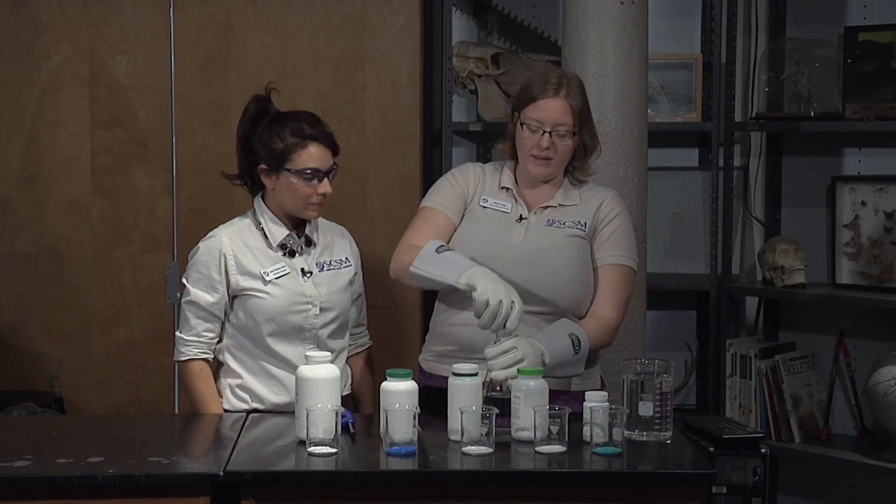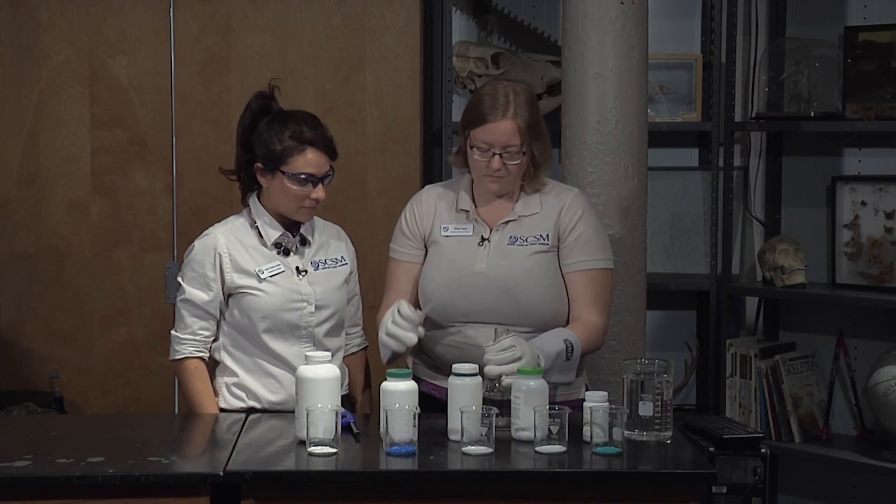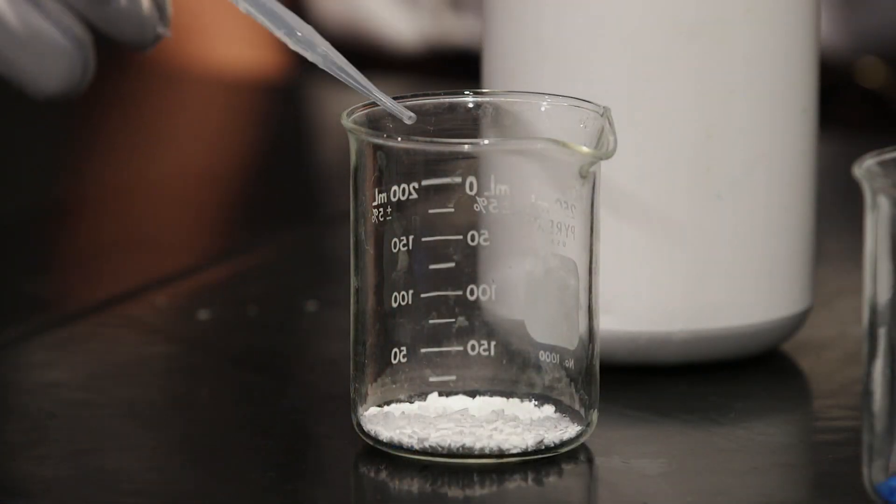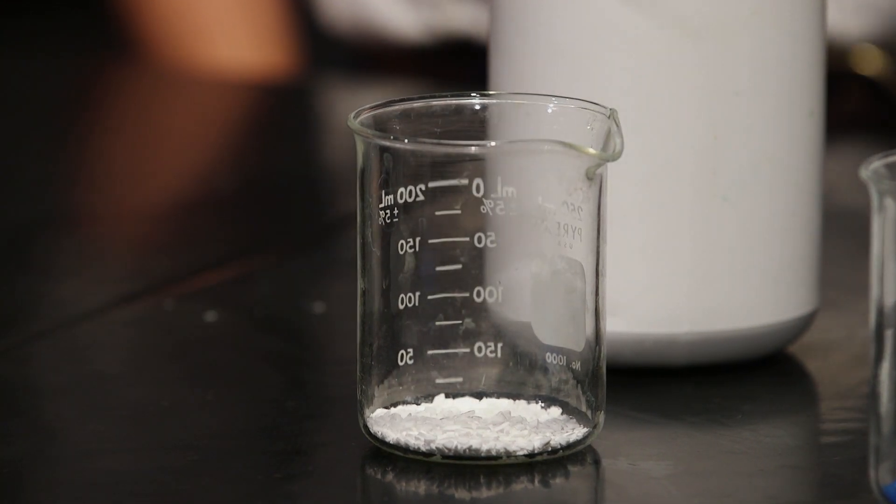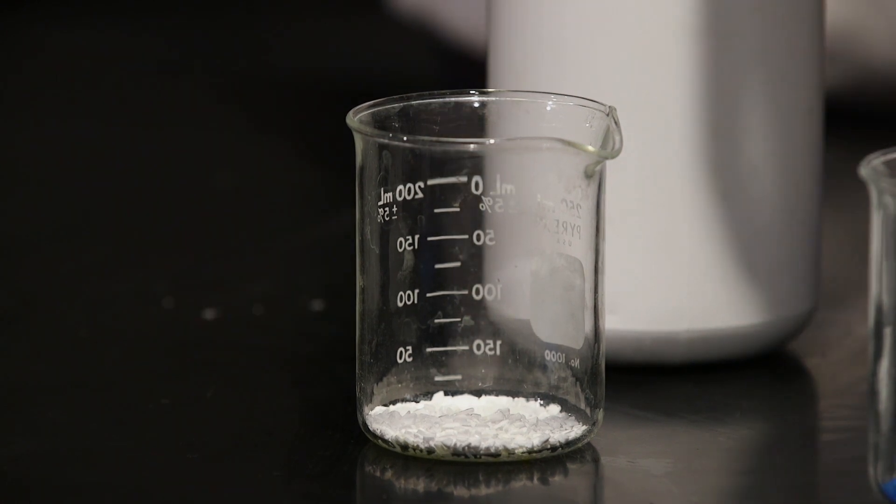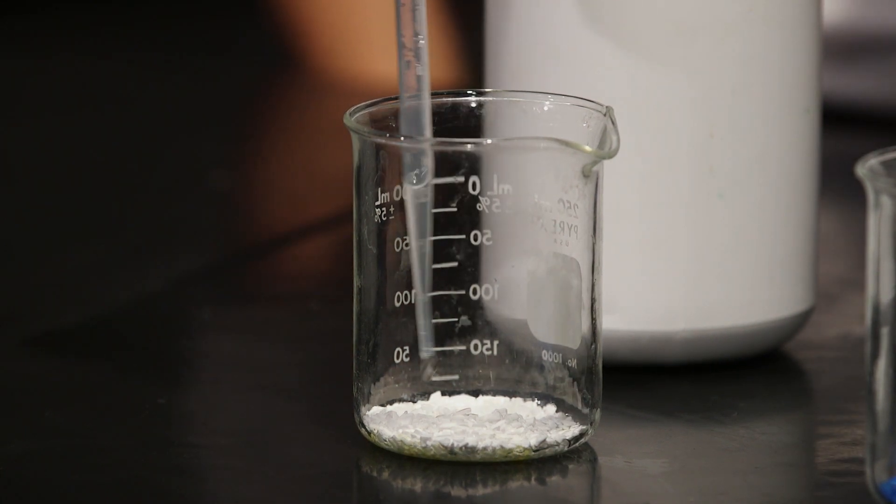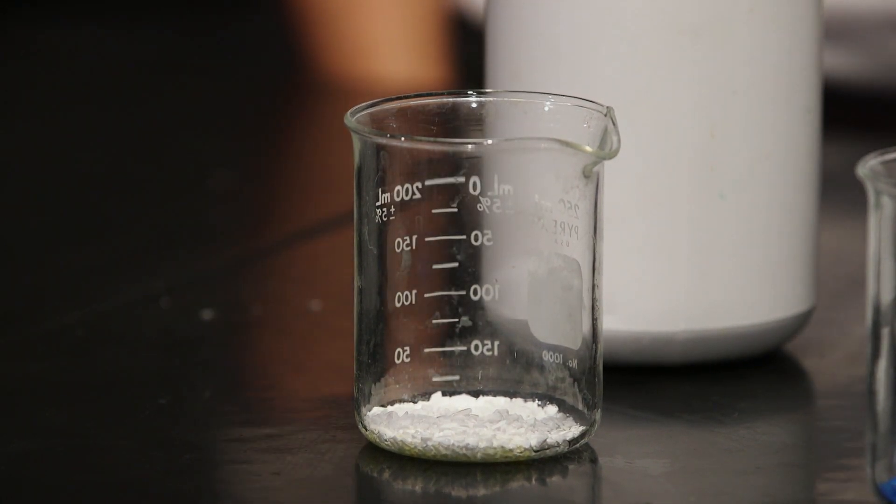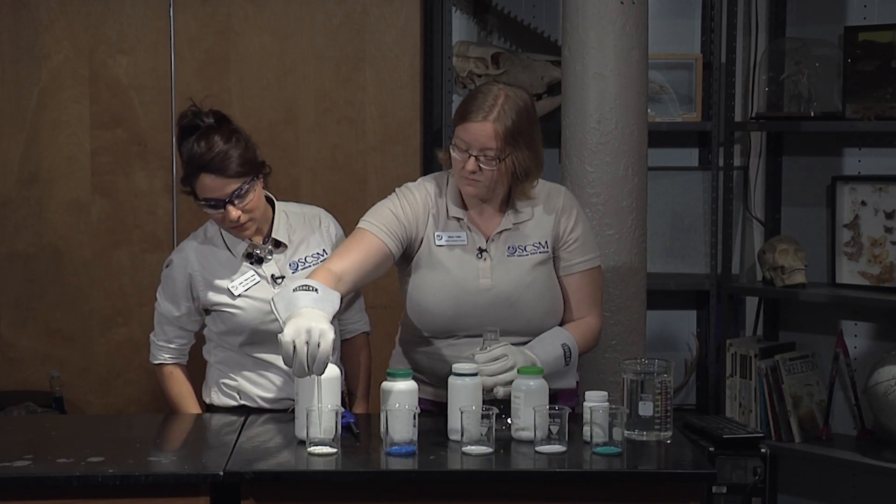So every time it goes into one of these we're gonna see blue first and then we'll see the actual color afterwards. We'll see that methanol catch on fire first with that blue color and then we'll see what color that salt really is. So let's get a little bit more.